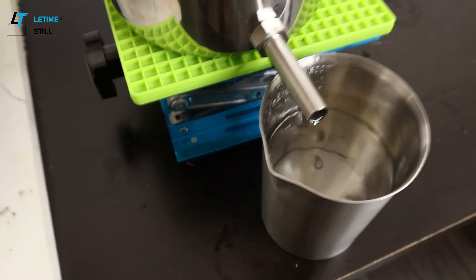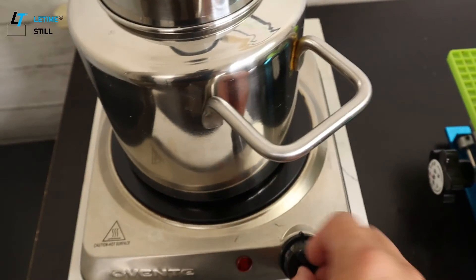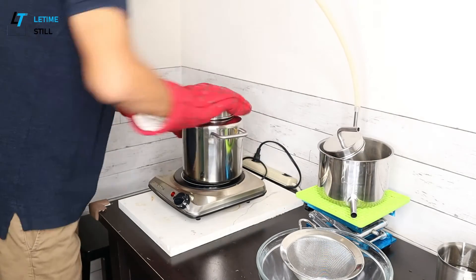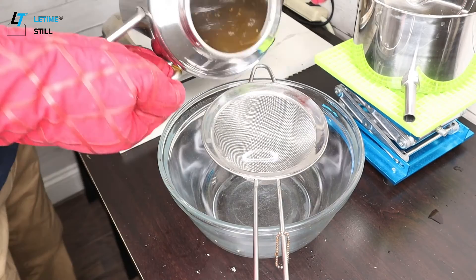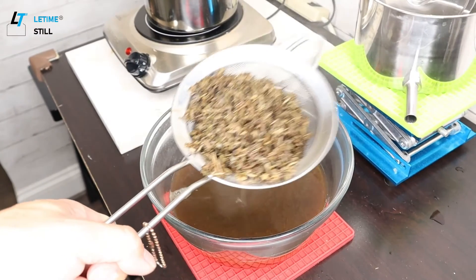After collecting the same volume of alcohol that I added into the tincture, I turn off the heat. We got the dark water extract and also the clear alcohol. The alcohol may have a slightly lower concentration than before because during distillation some water also comes up. Always check to make sure the concentration is over 70% before the next extraction or tincture making.